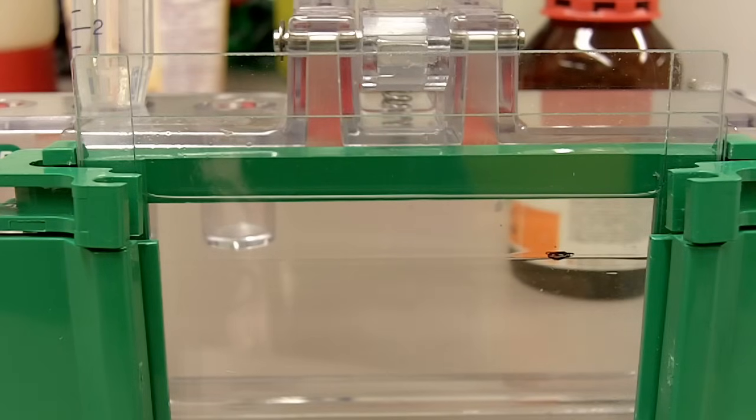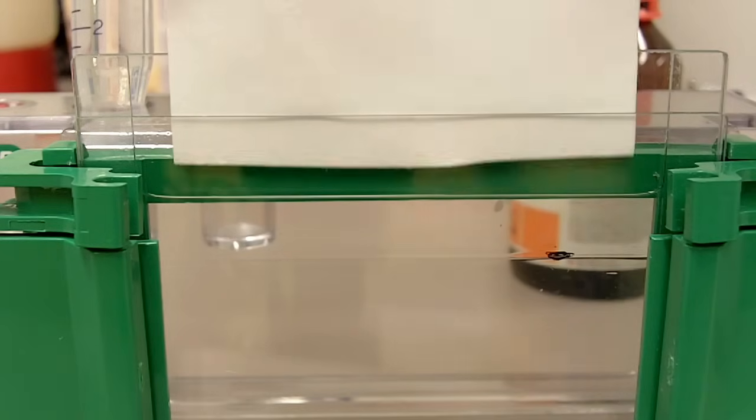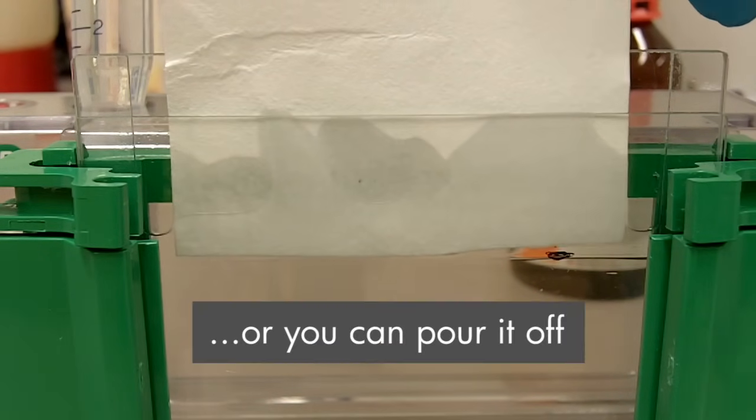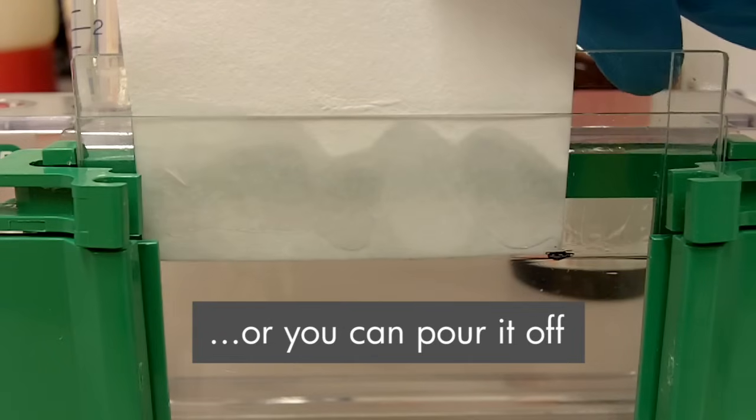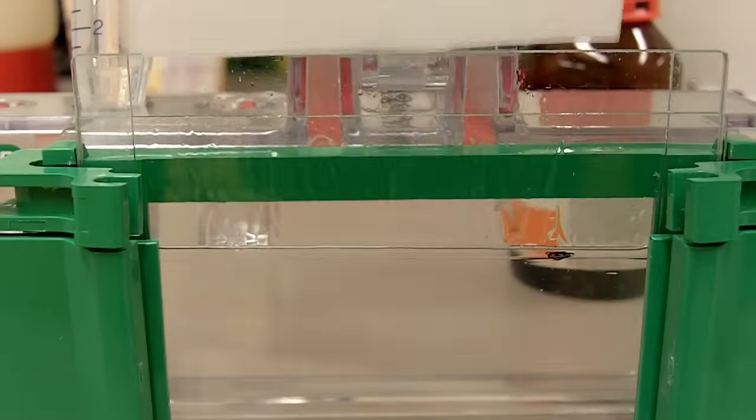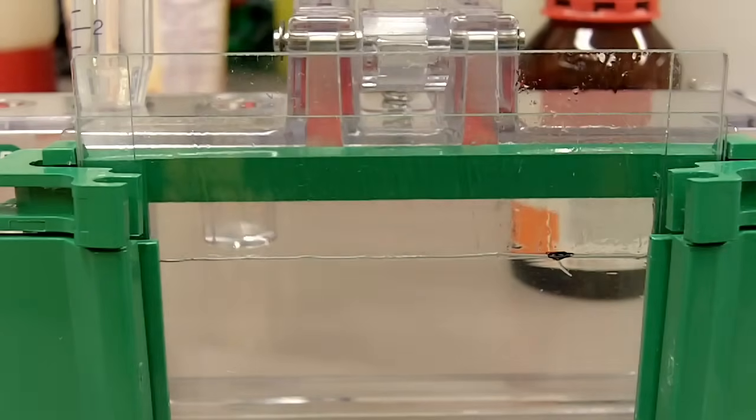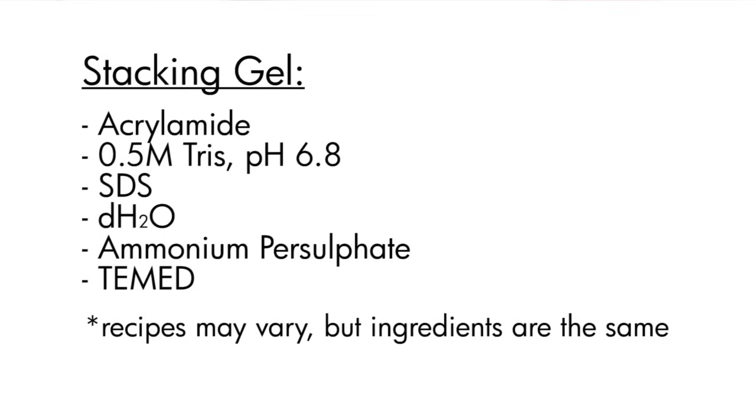So after the resolving gel has polymerized, we will dry out the isopropanol using the filter paper again. After we dry the isopropanol, we can cast the stacking gel.